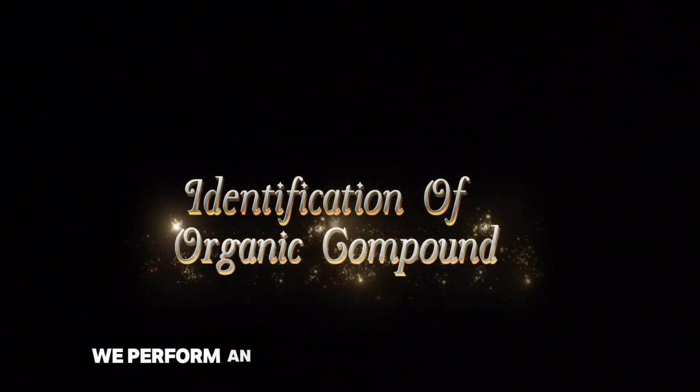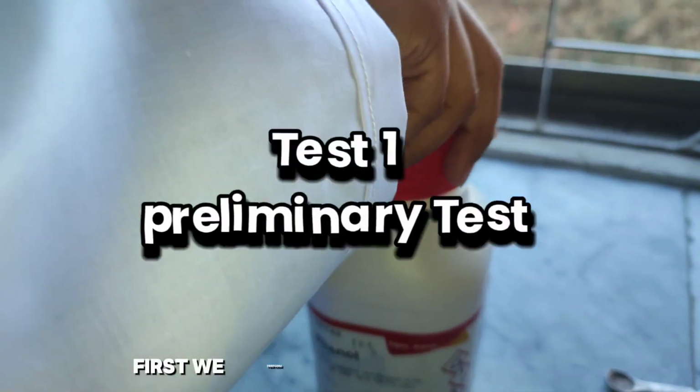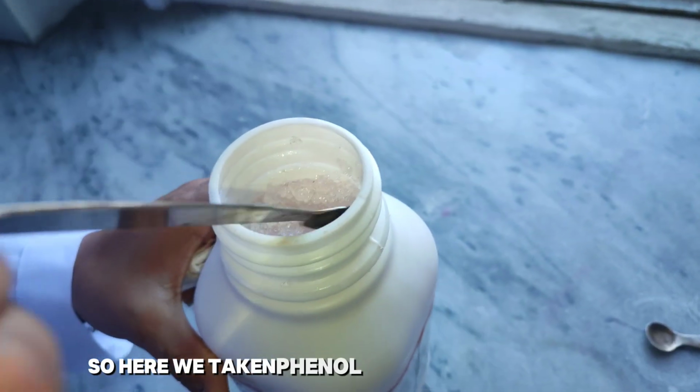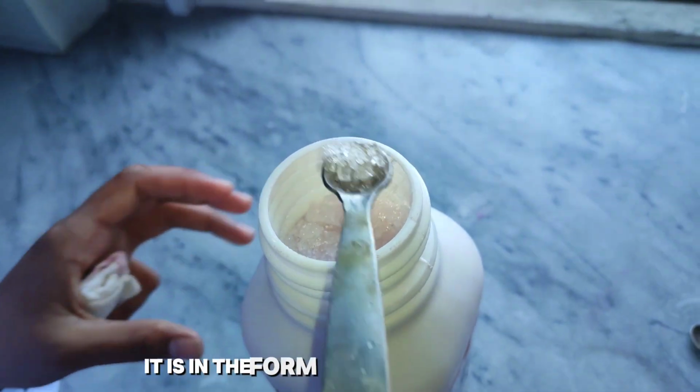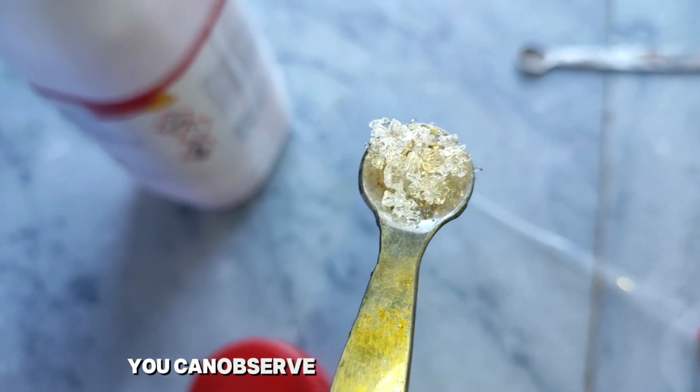Today we perform an identification test for an organic compound. First we perform the preliminary test. So here we take phenol. First thing we observe, it is in the form of colorless crystals and it has a characteristic smell. You can observe it when you are handling it.